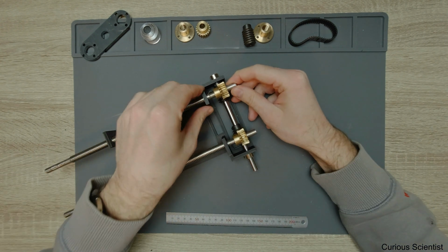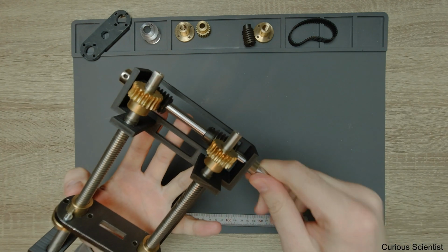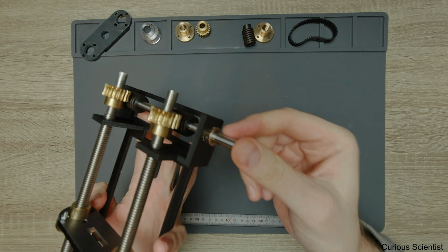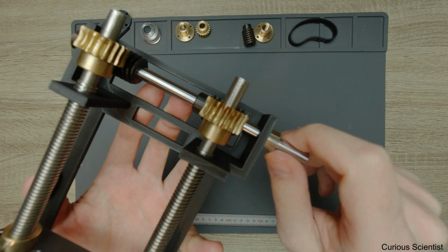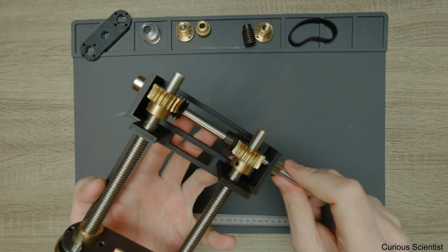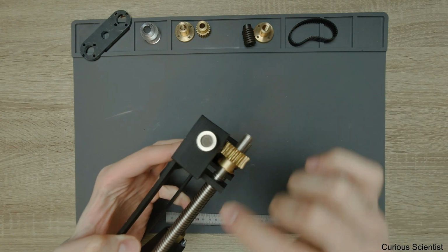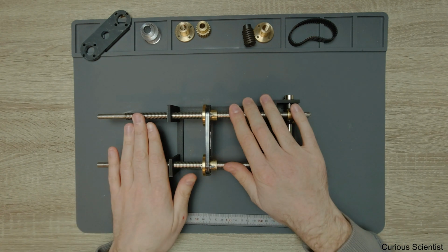And now I just wanted to check the dimensions, if I have everything fixed like here, if it works or not. And then if you see, I just turn this and it turns nicely, everything. Here I just put a collar here and here as well, so it will not move in this direction and I can rotate. And this, if you can see, it rotates pretty much nicely. And if I do it in the other direction, it does that as well. So no problems. And the dimensions and the relative positions of the holes and everything is just fine. And then of course this is also fine.